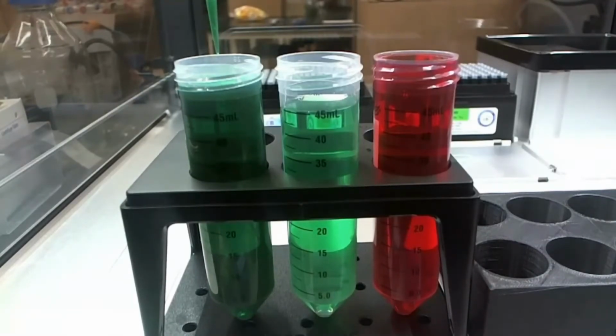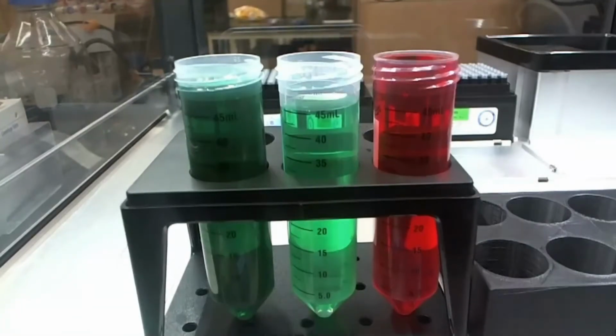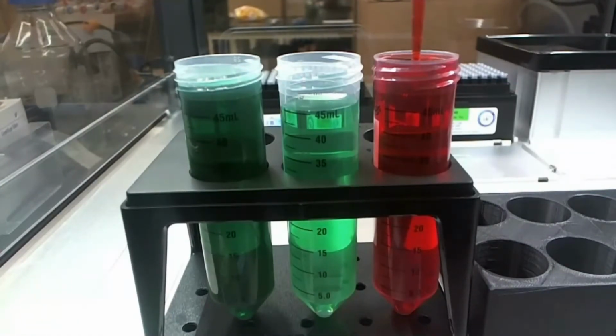Okay, so this is the last transfer until it hits 5,000 microliters. And so you'll see it spit it out. I'll try and do the side touch, then it'll go up. If you watch in the back by the trash bin, it'll kick out the pipette tip, and it'll move on to the next one. It automatically knows which pipette tip number it's on. So you'll see it come back. And now it's in the red. And we do it all over again.